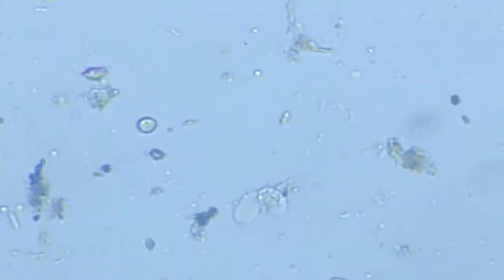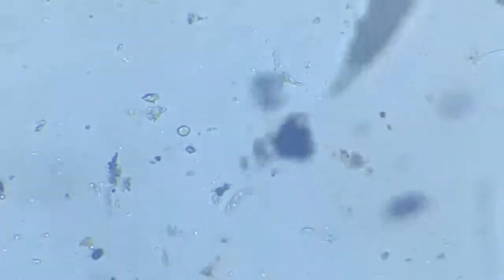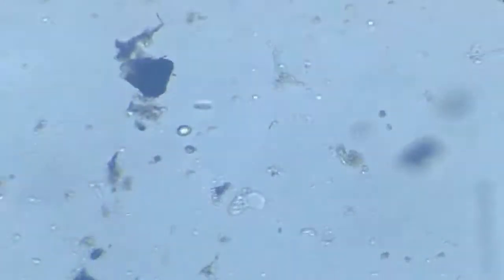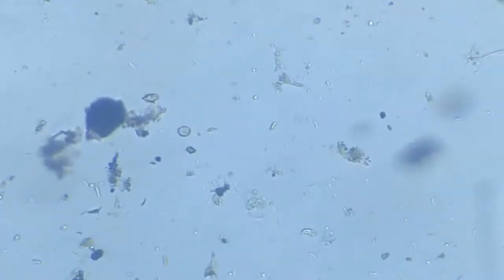We'll try to focus that flatworm again. First, let's just watch this amoeba for a while, and then we will also find some other unicellular and some multicellular organisms here in this slide. So I think we have had enough of this amoeba. We leave him to his own life, and then we proceed to, okay, this fellow is becoming too conspicuous. It wants to be seen. It just wants to be seen. So let's see it. There it comes again.